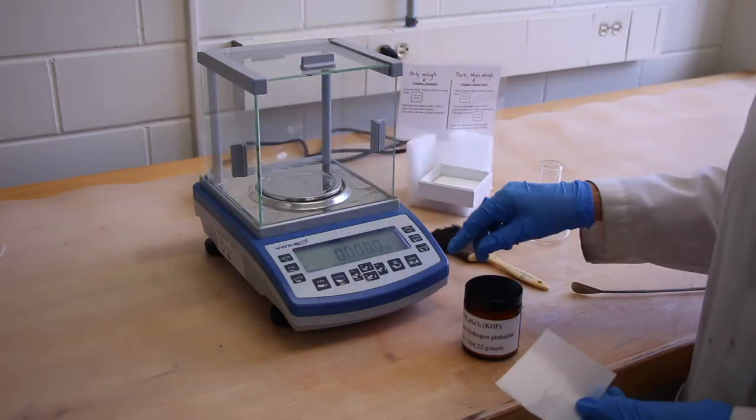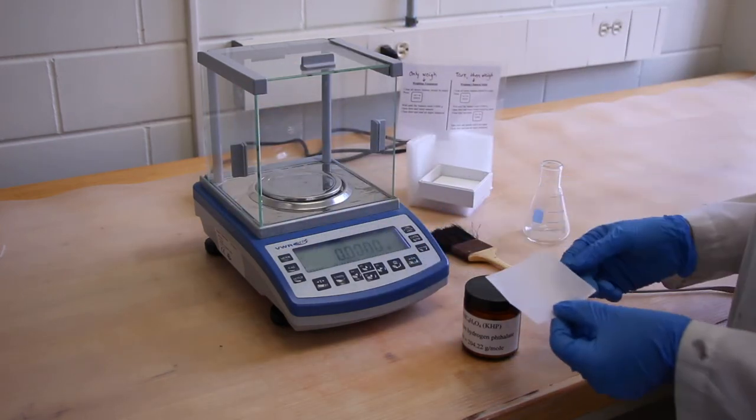So again, we'll make sure all of our doors are closed. Press tare, or zero.